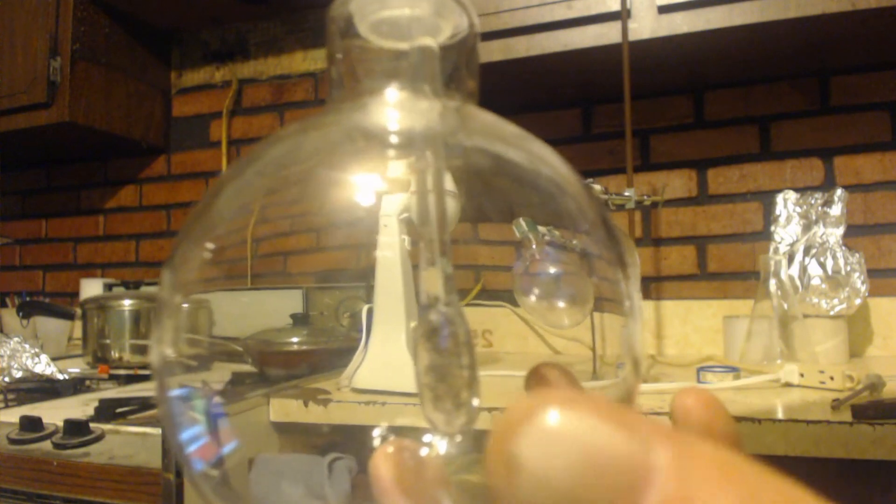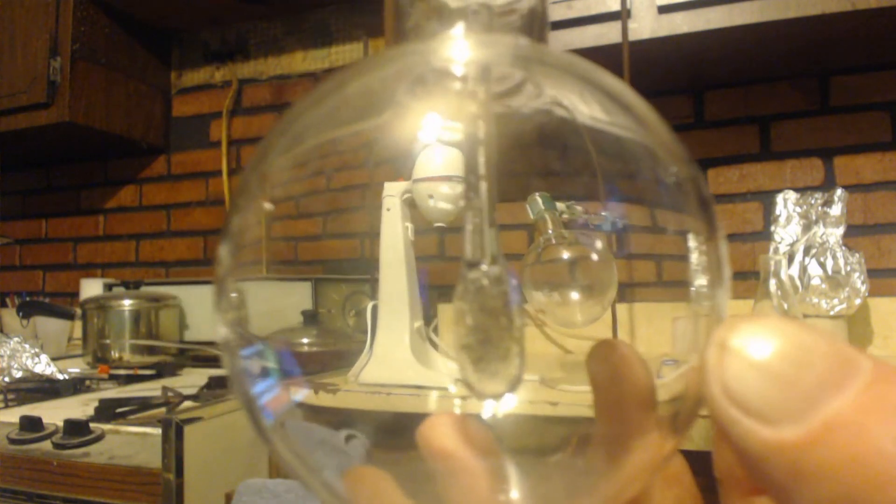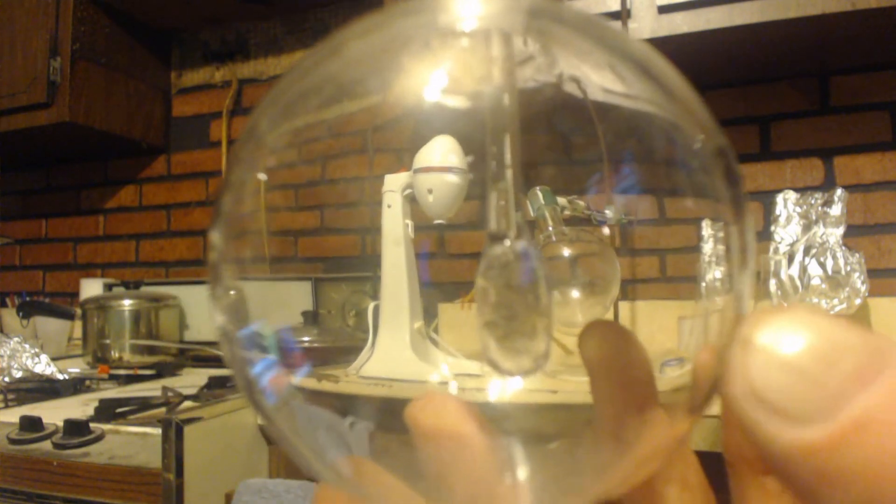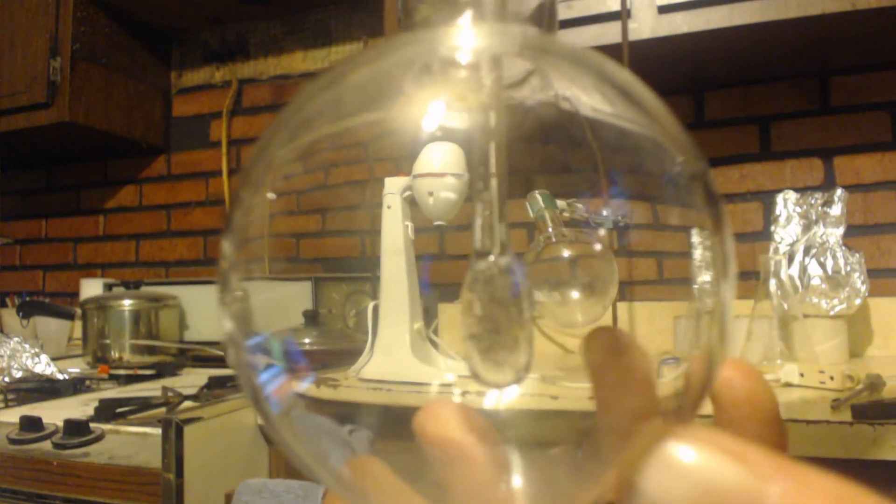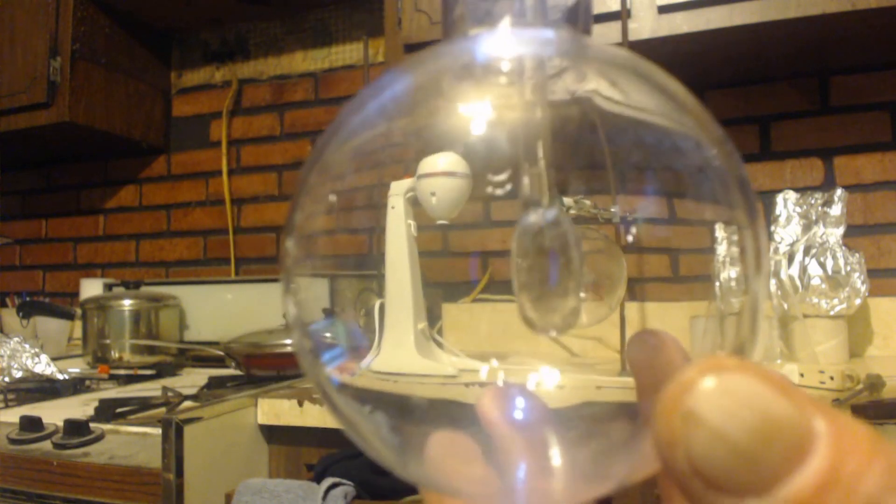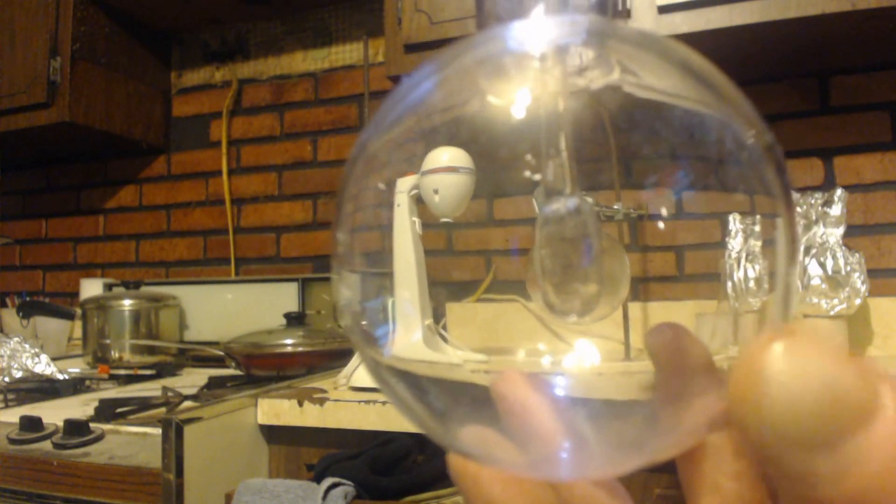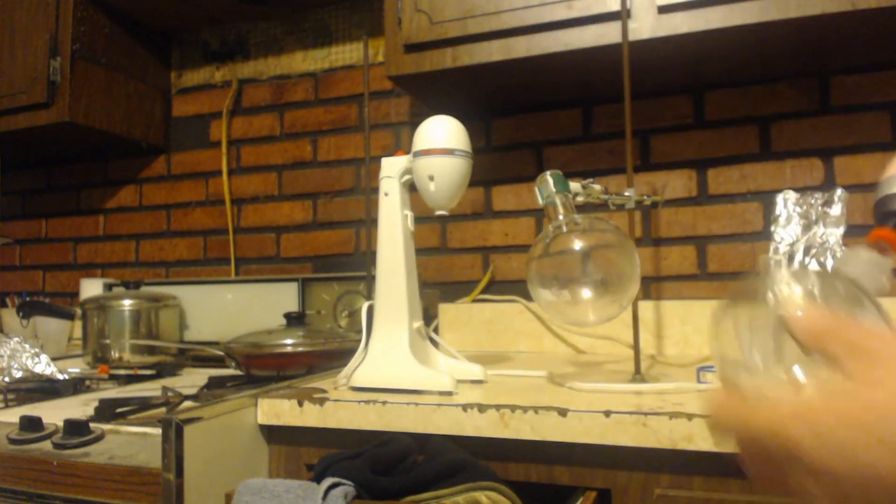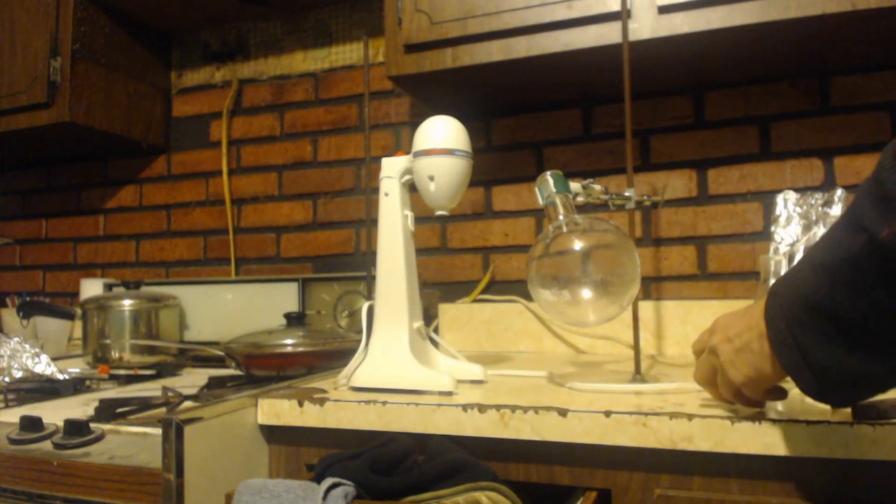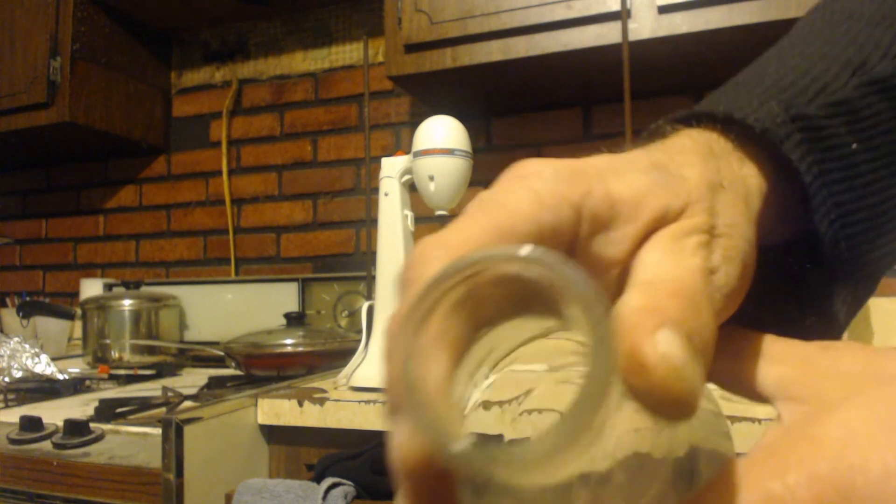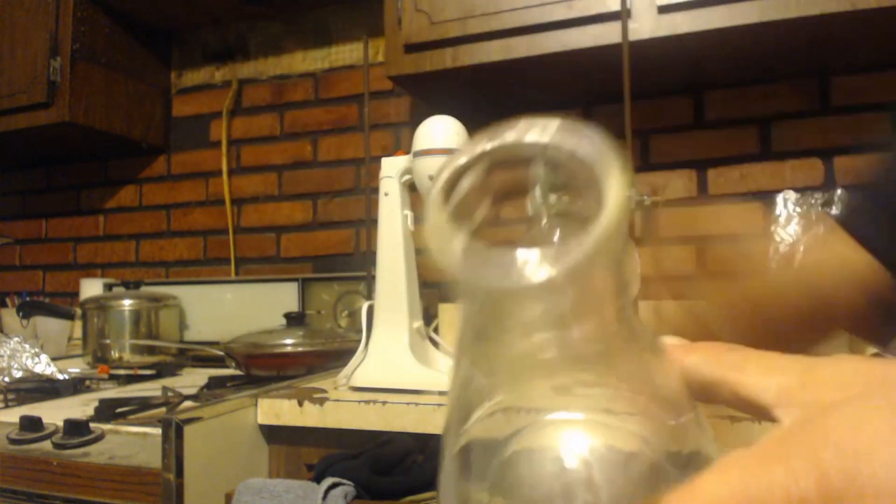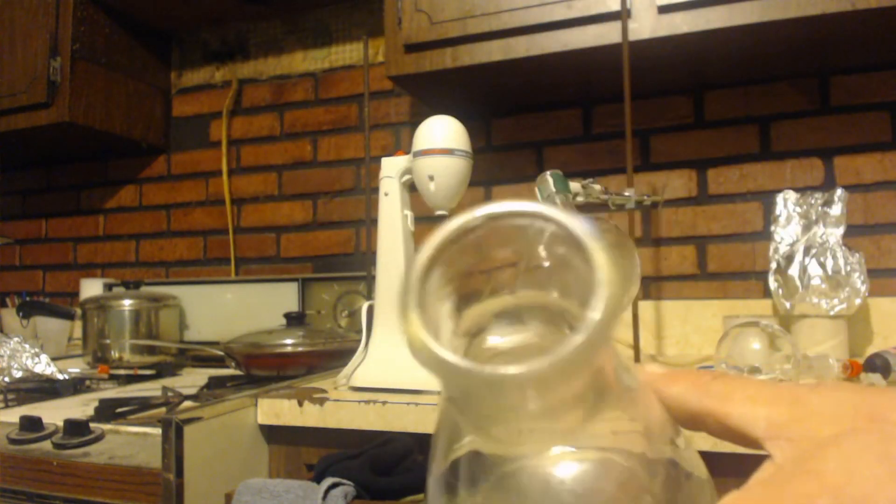Like I said, that pin should be a lot bigger, like at least three millimeters or two or three millimeters. It still doesn't make it that big, but the Erlenmeyer flask, you can make it even bigger, you know, like an inch or whatever, an inch and a quarter, an inch and a half wide.